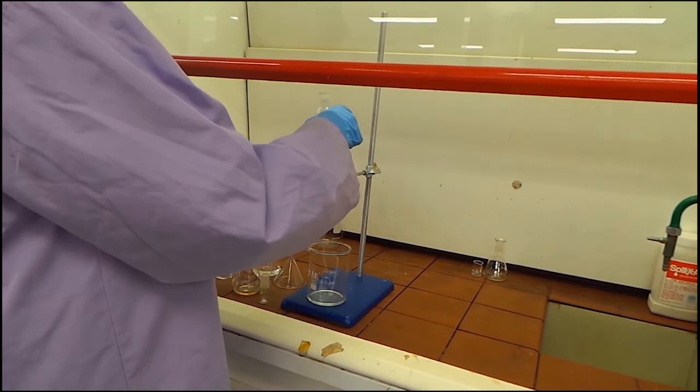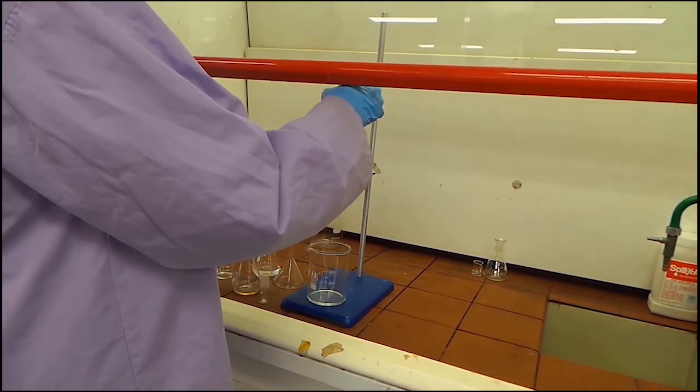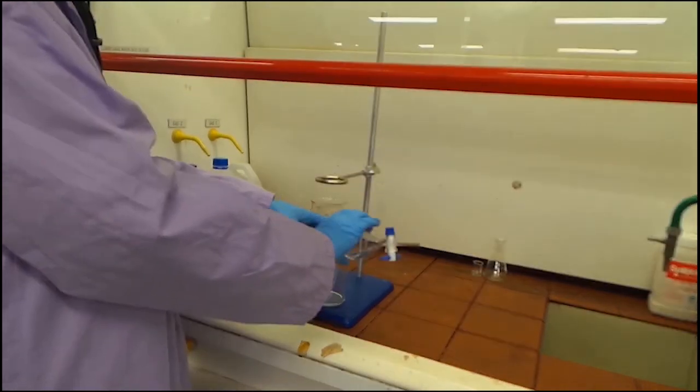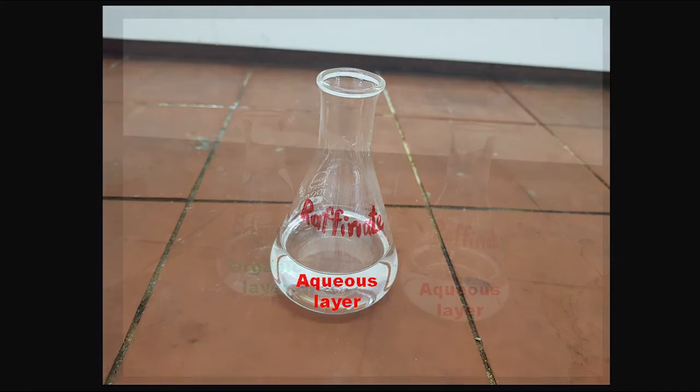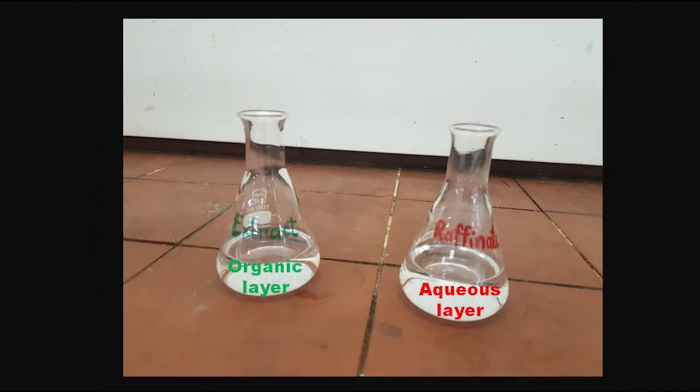The top layer should be removed from the top of the funnel. It is best to keep both layers until the analyte of interest has been isolated.